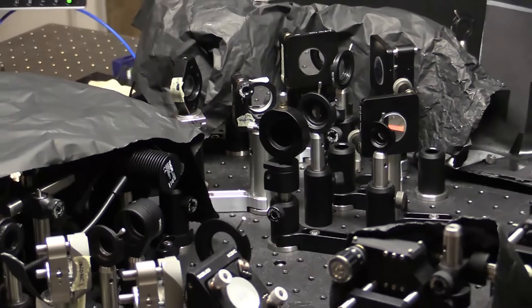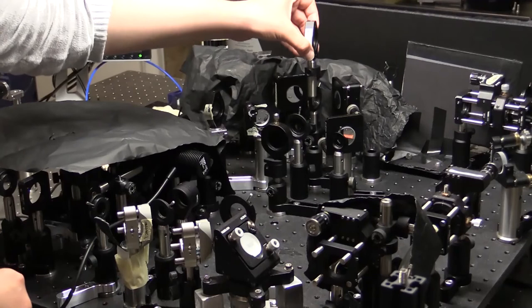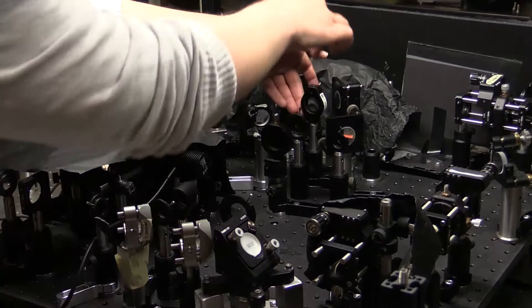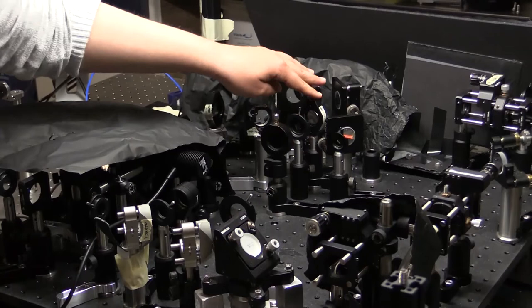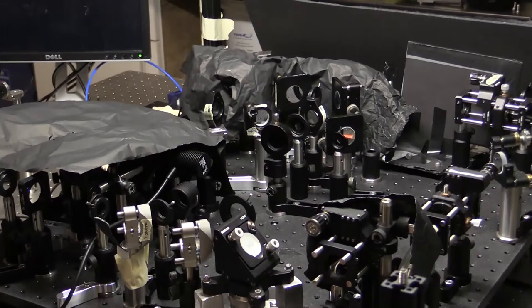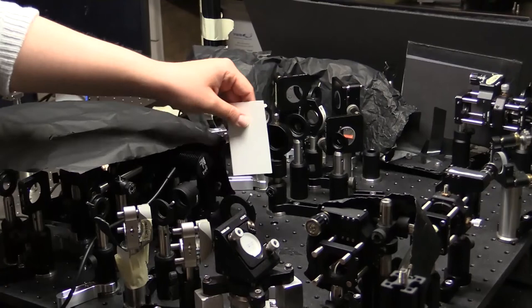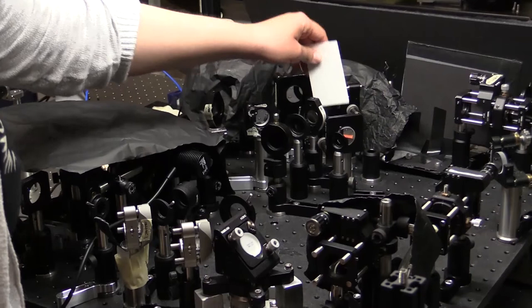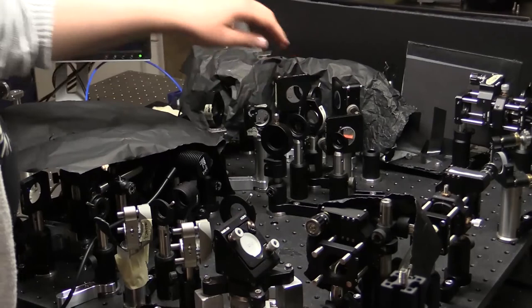Once we know where the beam is focused at the first lens, we then have to collimate our beam. We do this by placing our second lens roughly a focal length away from our pinhole. Again we want the flat side of the lens facing toward where the beam is focused. This is our collimating lens and it will allow us to re-collimate the beam so that we can send our beam to our detector wherever it is. In order to make sure this lens is in the correct location, the beam should be collimated. We're lucky in my sample in that we can see a little bit of the beam. If you can't see your beam, you have to be very careful and wait until you can get a detector that can see your beam in order to make sure that it's collimated.